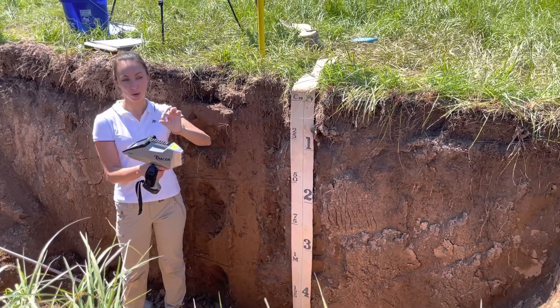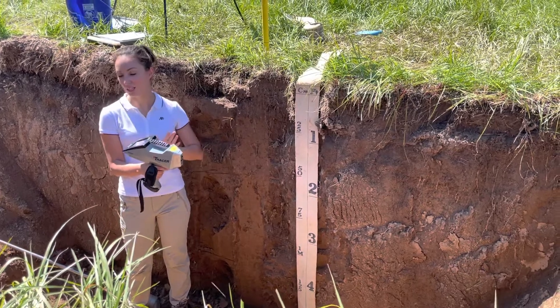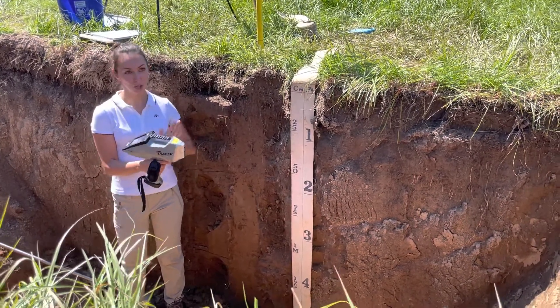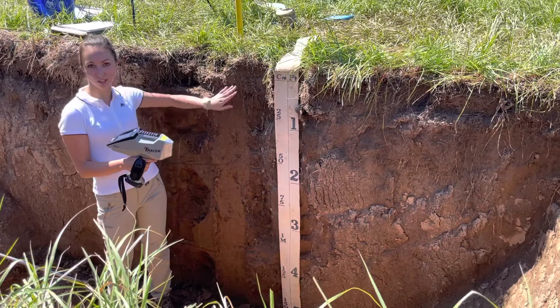Typically in the lab we have either XRF cups — special plastic cups that come with it — or plastic bags. But we can directly use XRF for any materials. Solids are preferred, but liquids can be measured as well. So here we'll see how concentrations of some elements changed in the horizons.